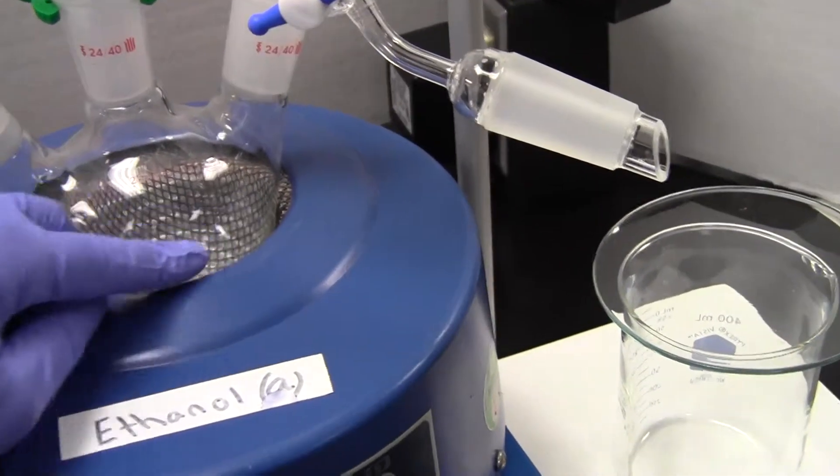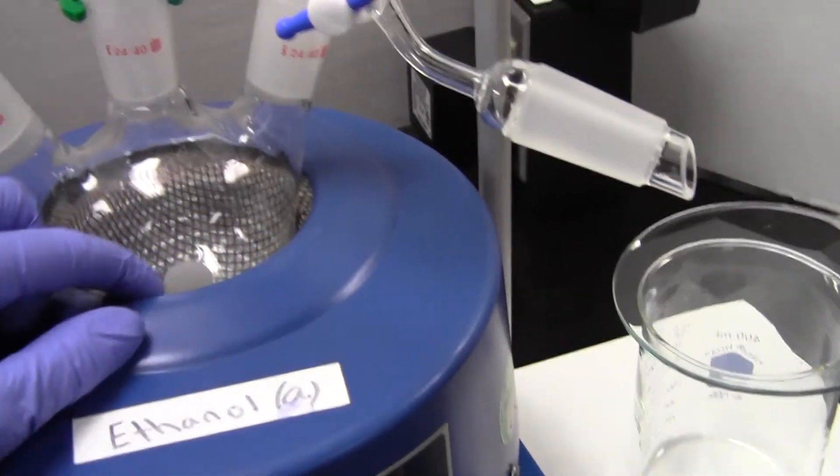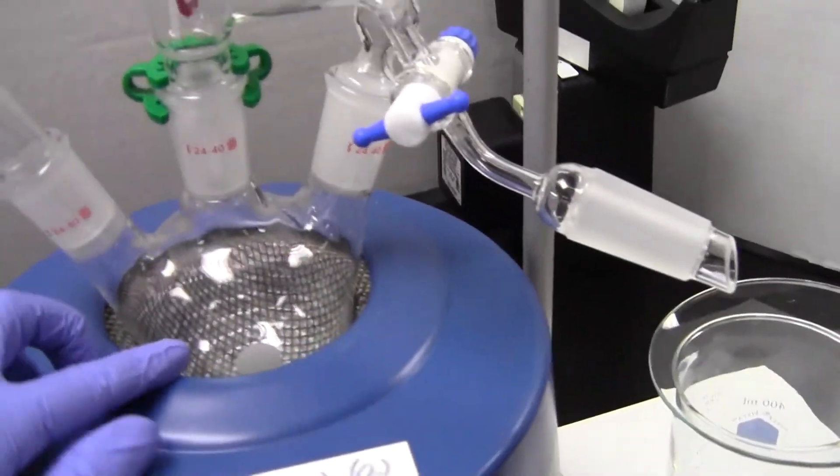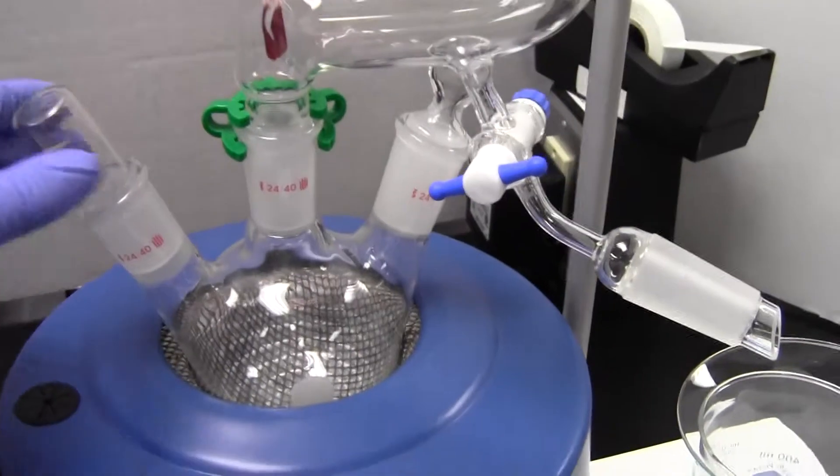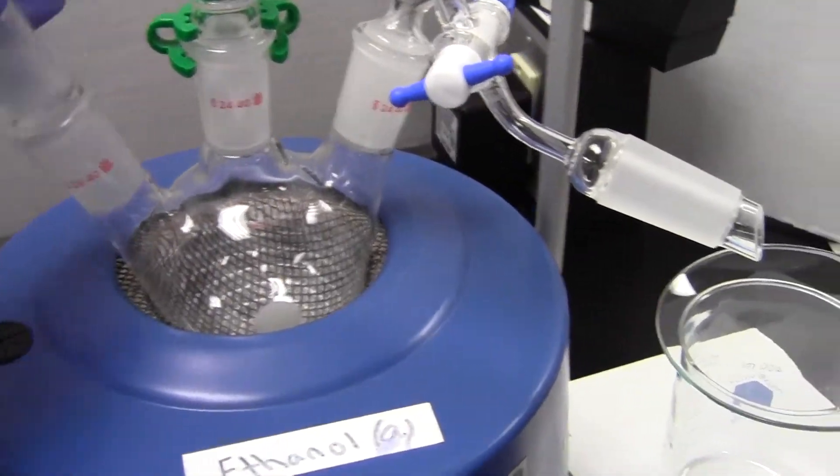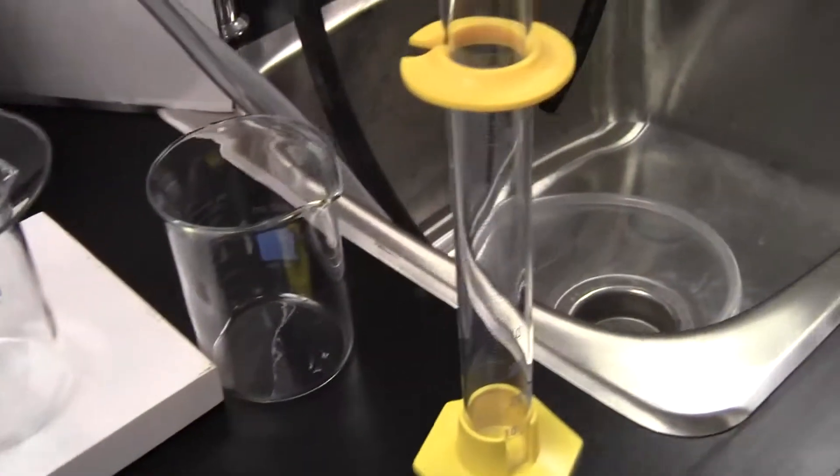Add the ethanol right through here. You don't have to measure the volume precisely; you can use a graduated cylinder for that.